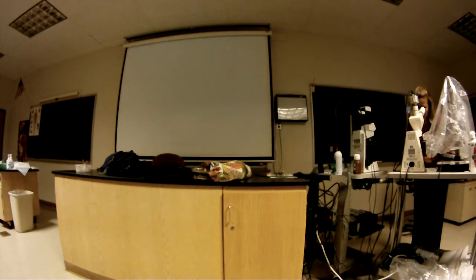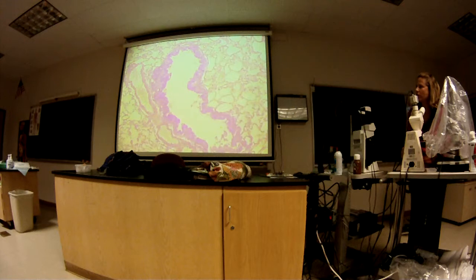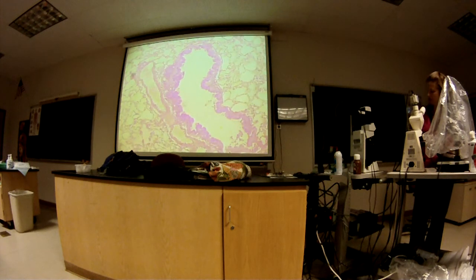Okay, let's look at this one. This is a different structure. Okay, so we're still within the lung. I didn't change the slide. We can get a little closer, but this is the structure in question. These are over here. We've got some veins, so some kind of stretched out veins. If you look closely, you can see the little red blood cells and a little smattering of white blood cells in there. And so this is the structure we're looking at here.